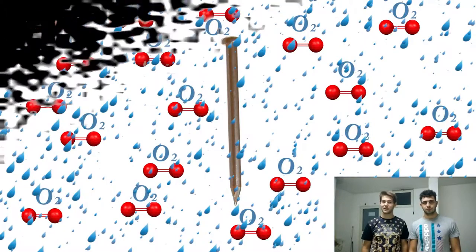In our case, chlorine is actually a very strong gas. Chlorine reacts really fast with our metals and our coins because it is much more reactive than oxygen with these metals. We will see that the product of the reaction will form quickly, while the reaction of oxygen with metals, which forms rust, is actually really slow compared to chlorine.